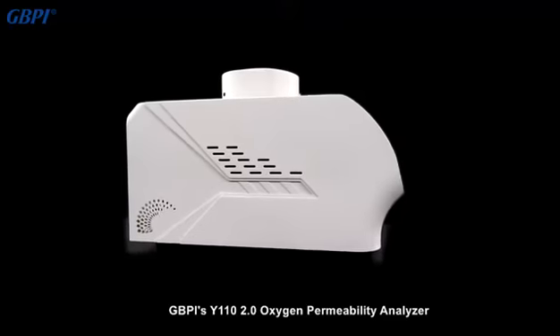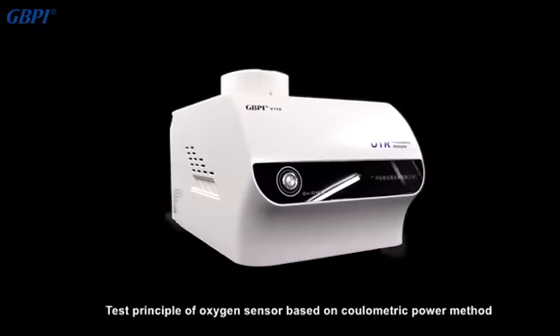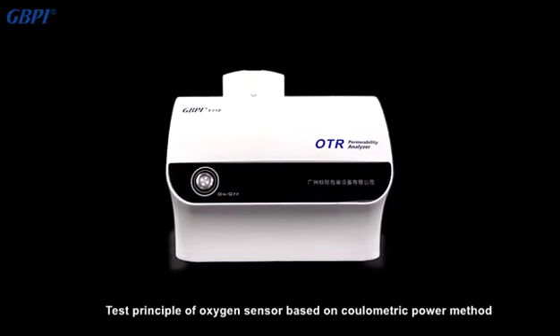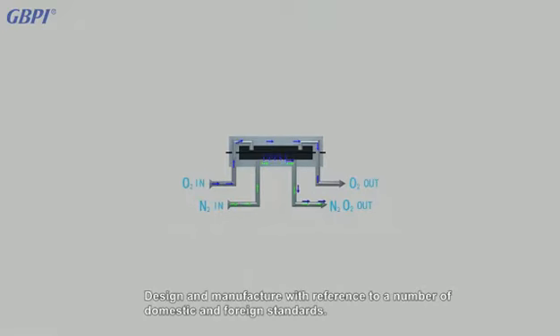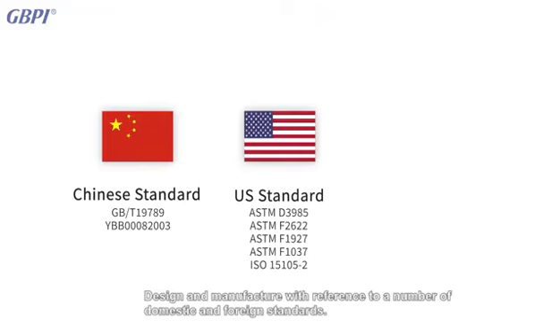GBPI's version 2.0 oxygen permeability analyzer test principle is based on the coulometric method design and manufactured with reference to a number of domestic and foreign standards.